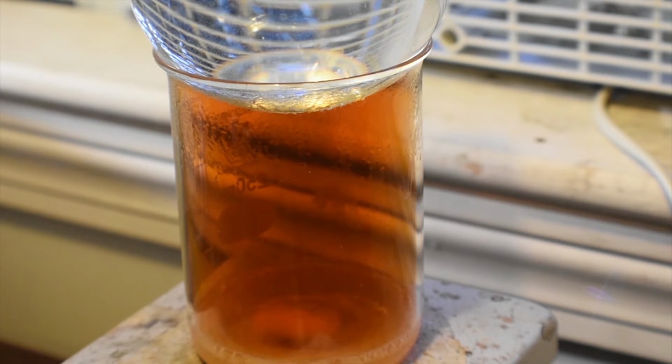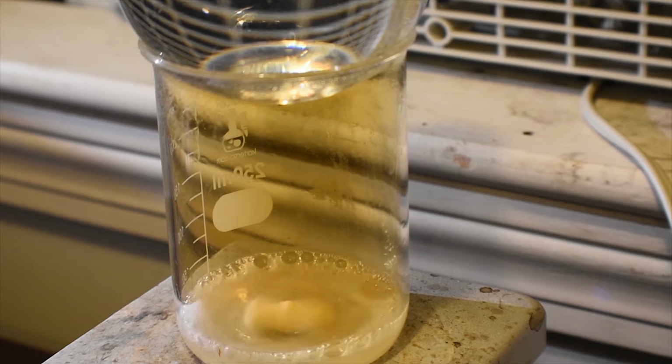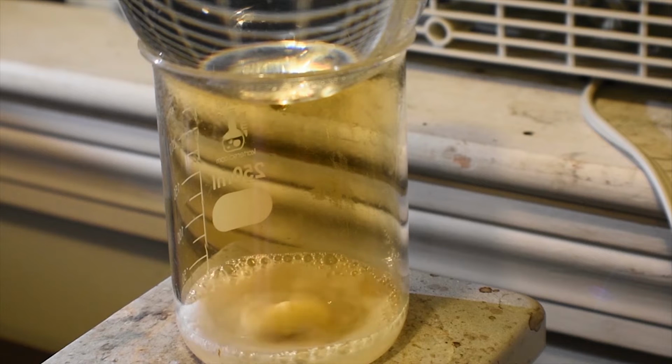And you can see the nitrogen dioxide evolution started again, which means there probably is a reaction going on. So I will leave this for probably another hour to react, changing the flask water out a few times, probably about 2 or 3 times in that time span. And then we'll continue on, basically. Okay, it's been about an hour and a half, almost 2 hours, and we're about done, so I'm going to go ahead and turn off the heat, but I'm going to keep it stirring.